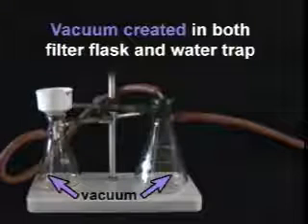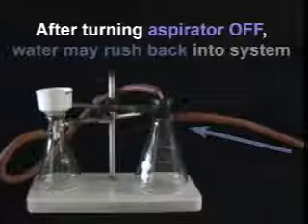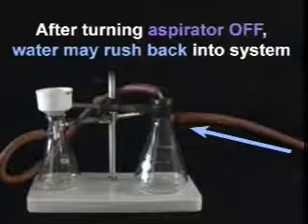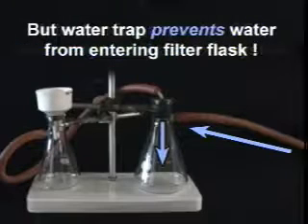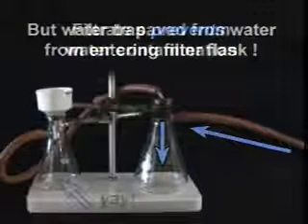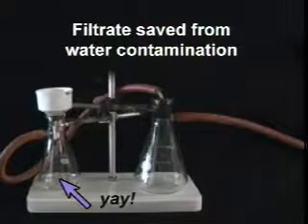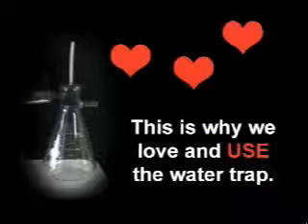Now we can filter. When we finally finish, we'll have to turn off the aspirator. This may cause water to rush back into our system, and this could be potentially bad. But look! Our water trap prevents the water from entering our filter flask. And so luckily our filtrate is saved from any water contamination. Yay! This is why we love, and more importantly, use the water trap.